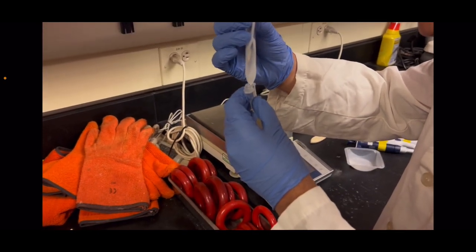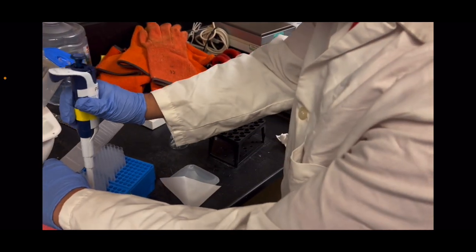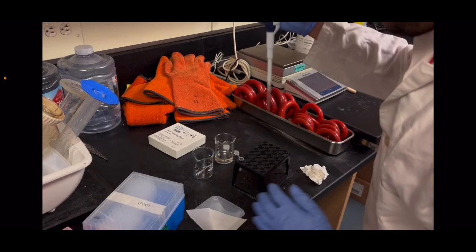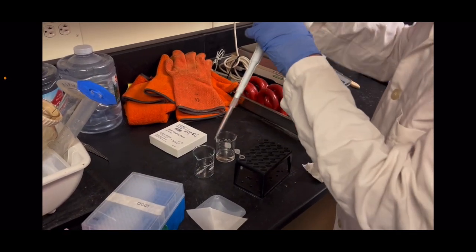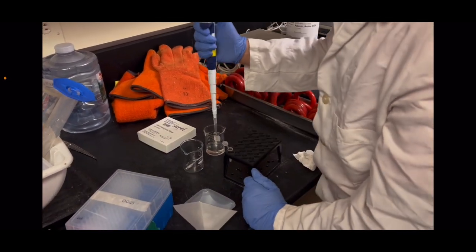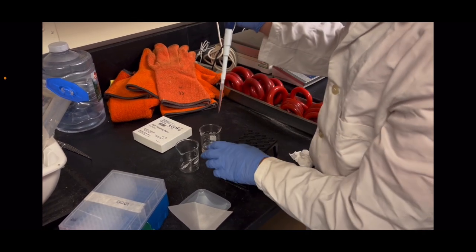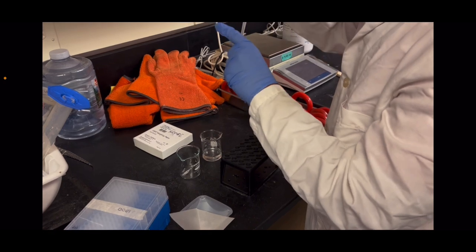So first I got 0.1 grams of BSA, and now I'm going to be adding 1 ml of water to a 1.5 ml tube. I mixed it by pipetting up and down and by flicking it.